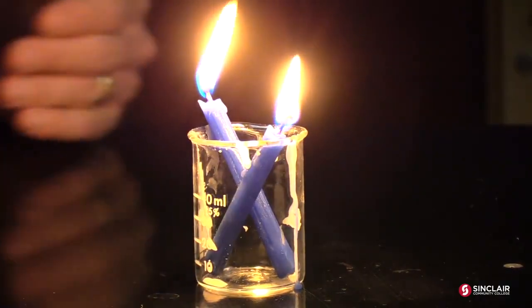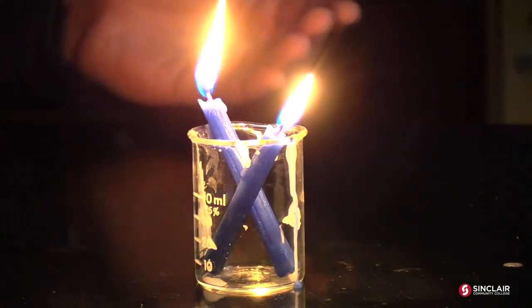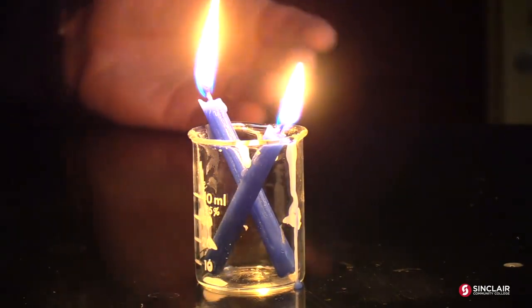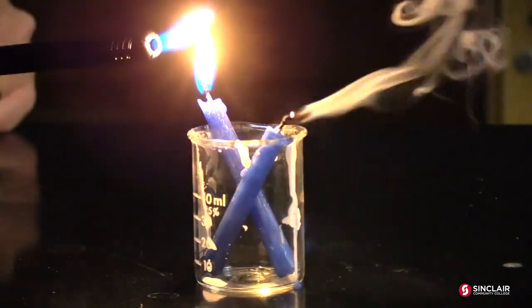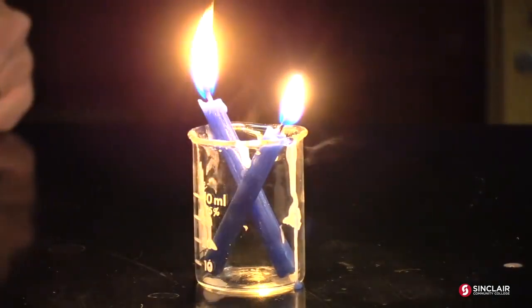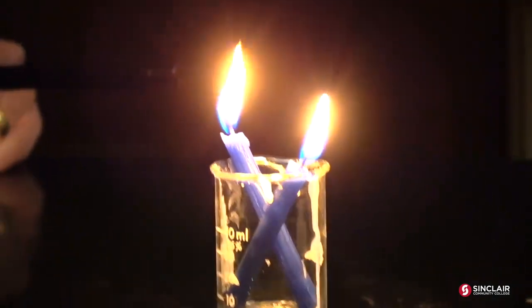Now what I'm going to do is I'm going to blow out the candle and then immediately relight it without touching the wick. Because it's really the vapors that are doing the burning. Didn't have to touch the wick at all. Cool.